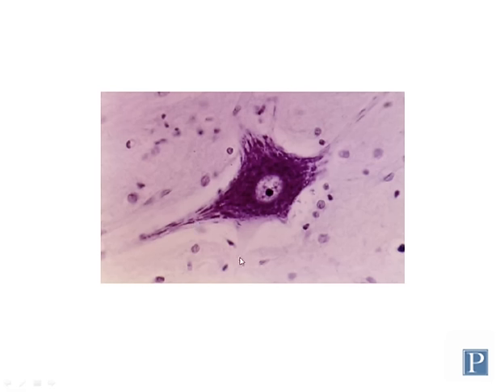However, the axon, which you can see down here, does not contain any Nissl bodies. So in this case, you can see the axon because of some background staining here. You can see its silhouette, but it is notably lacking Nissl bodies, so you know this can't be a dendrite.